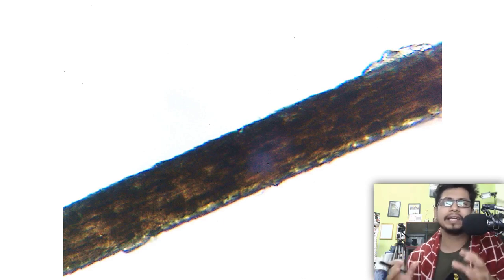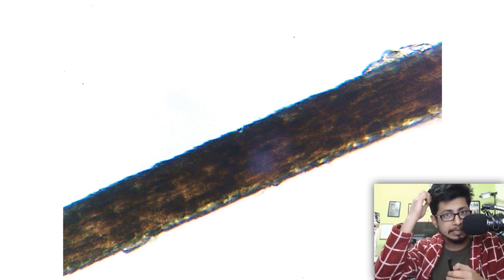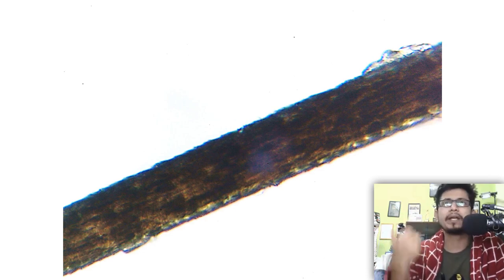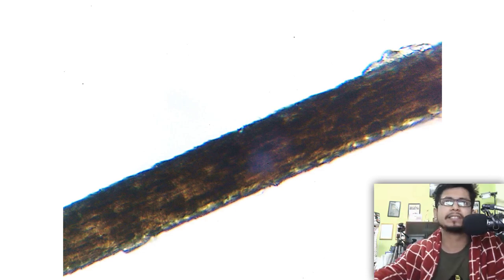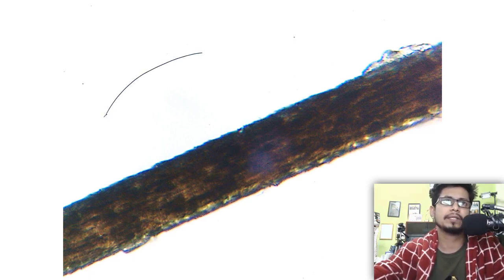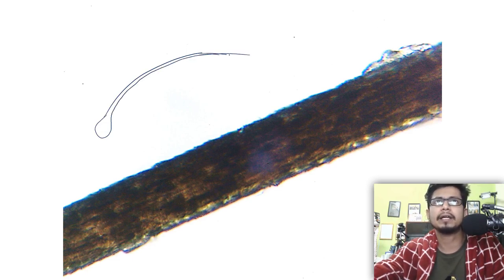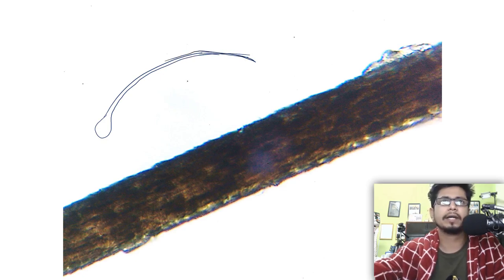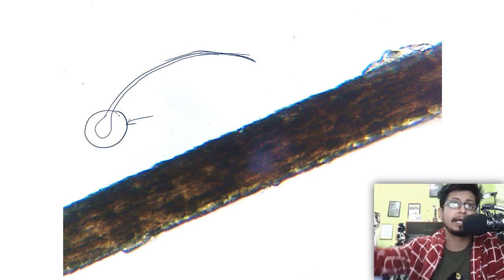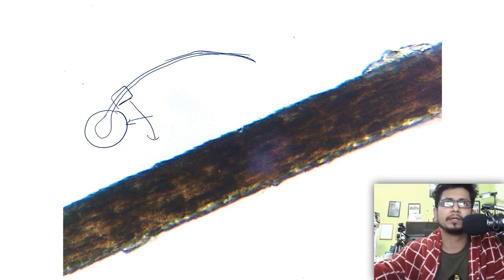In this video we're going to see the human hair under microscope. We are not going to see the hair from the skull — we're going to see the hair from our eyelash. This is the eyelash that I picked and put under the microscope. Normally hair looks something like this in pictures, with follicles at the bottom. We fail to see the follicle in this case because it's not hair from the skull cap, it's from the eyelash.